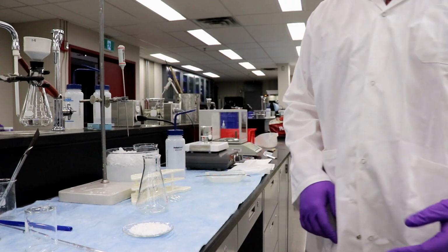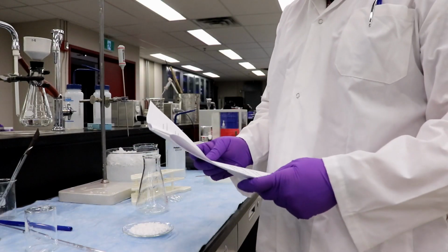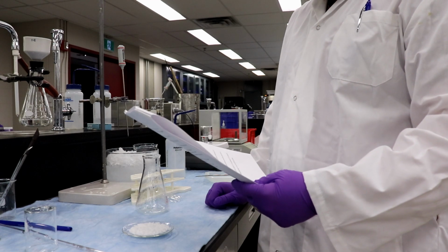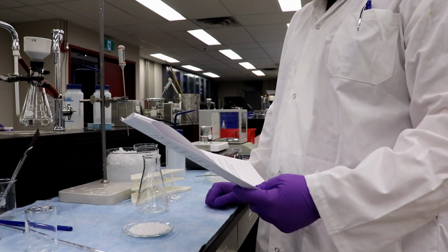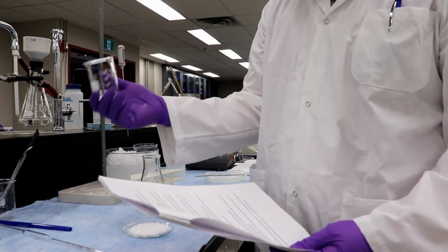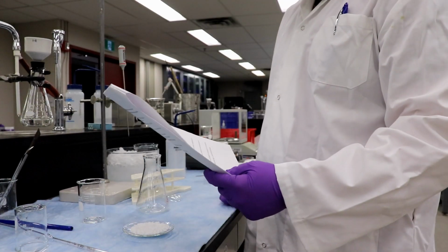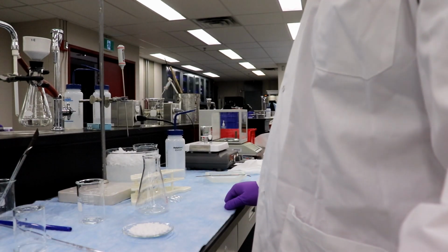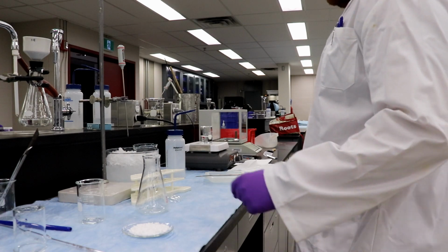So the purification step is as follows. Part 1, part 2, part 3. Purity test. Recrystallization. Weigh about 1 gram of crude product on the analytical balance and transfer to a 150 milliliter beaker. Check. Return the rest to the oven. Okay, so about 1 gram and to the beaker. The weigh boat's right there.